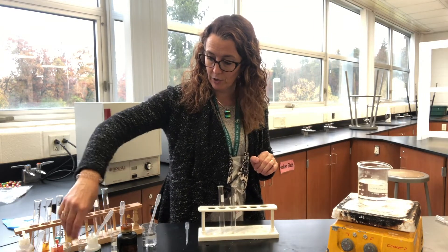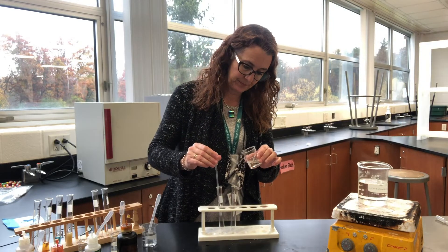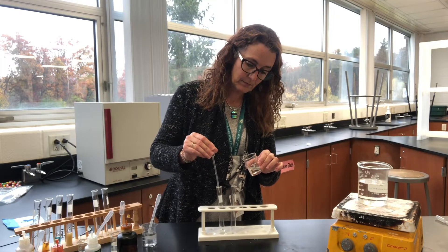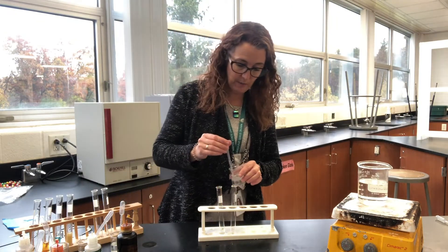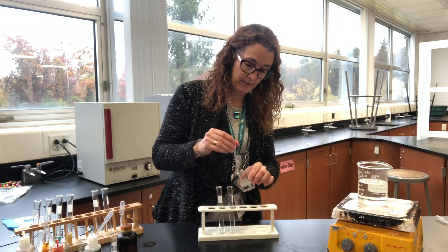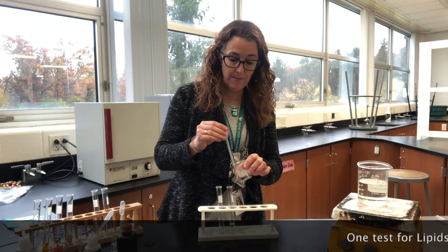Our next test is going to be for lipids. I'm going to put some regular cooking oil into the first test tube, and then in the next test tube I'm going to add water just like before. You should know that oil and water do not mix.